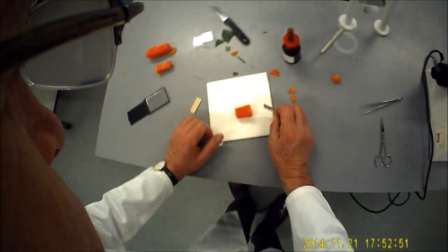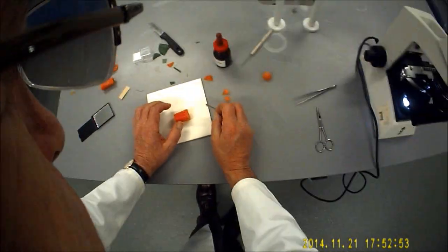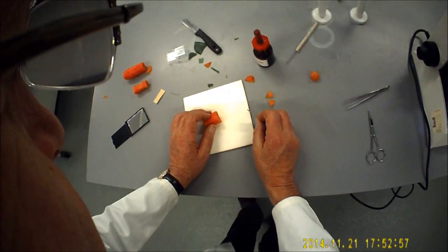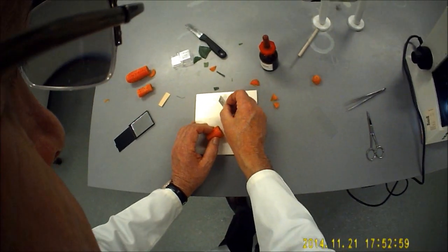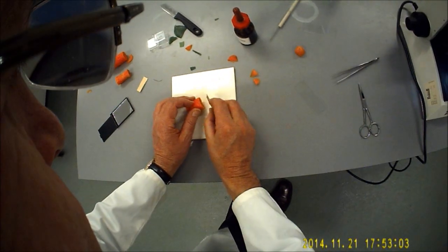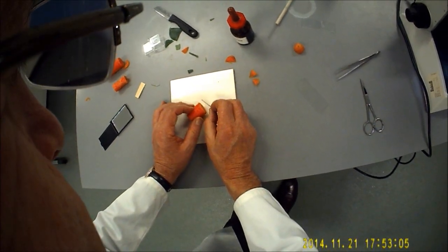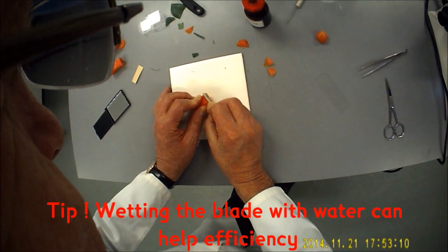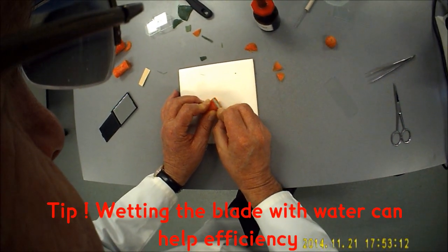It'll probably take you something like 30 or 40 cuts before you get four or five decent specimens. As luck would have it, that actually isn't bad, that one there. What you do is you imagine that you're turning into a bacon slicer in a butcher shop and you just start to do it very fine.